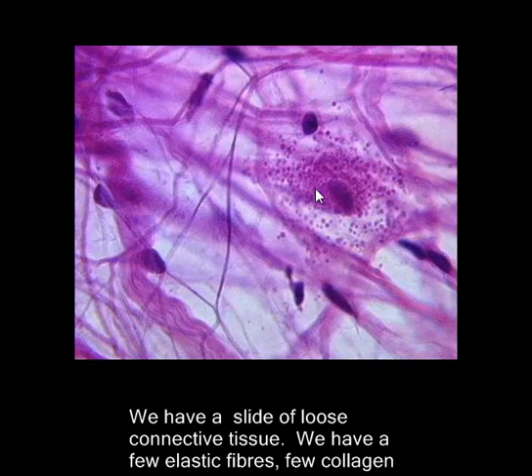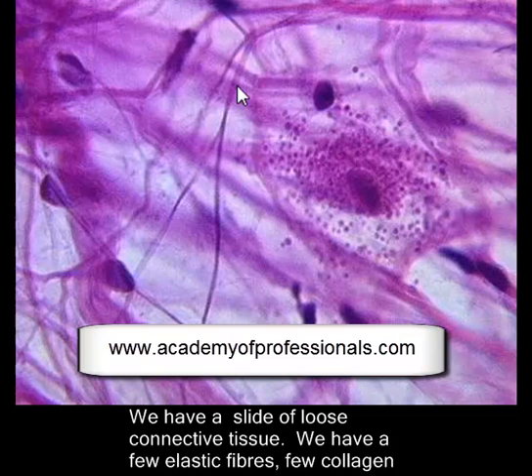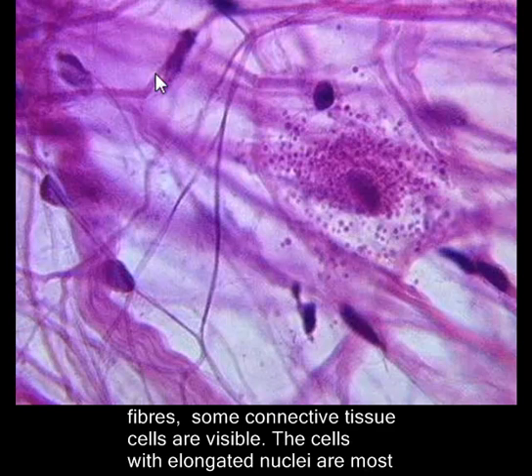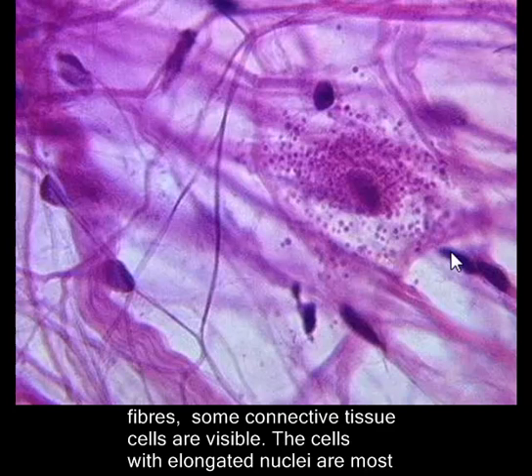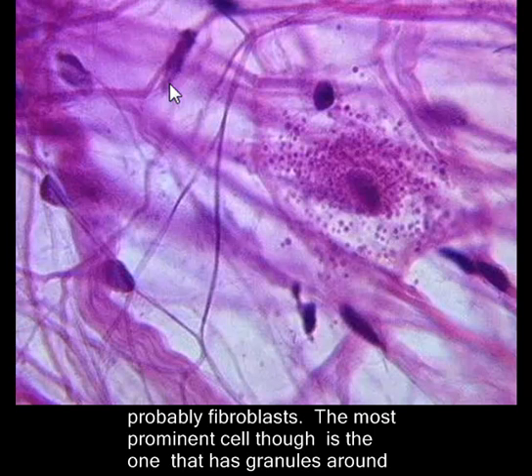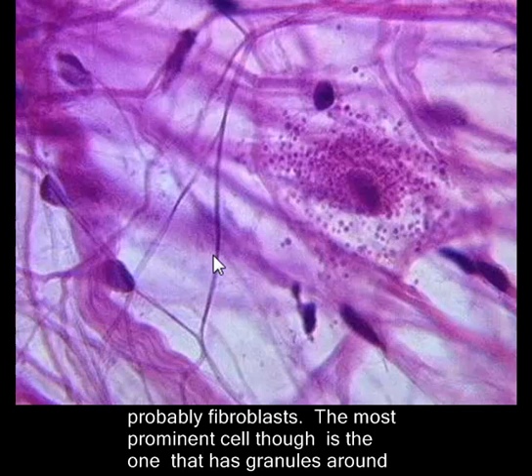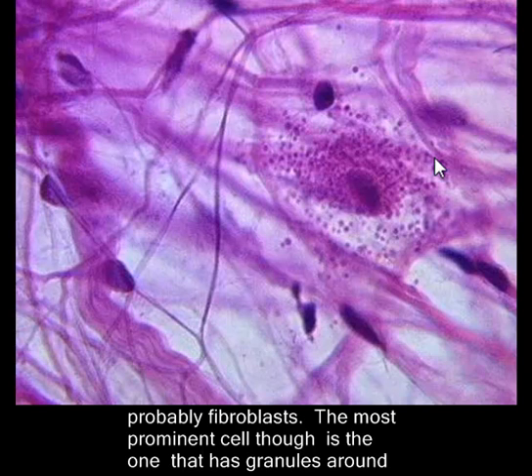We have a slide of loose connective tissue in front of us. We have a few elastic fibers — thin thread-like structures — and a few collagen fibers, which are thick threads. A few cells of connective tissue are visible. These are the nuclei; the cells with elongated nuclei are most probably fibroblasts, which are the most important cells of connective tissue and actually make these fibers.